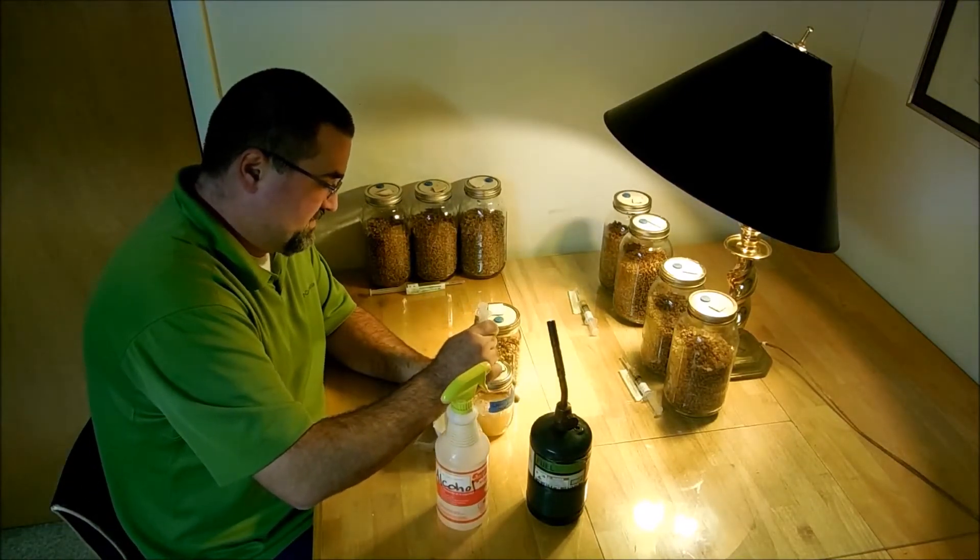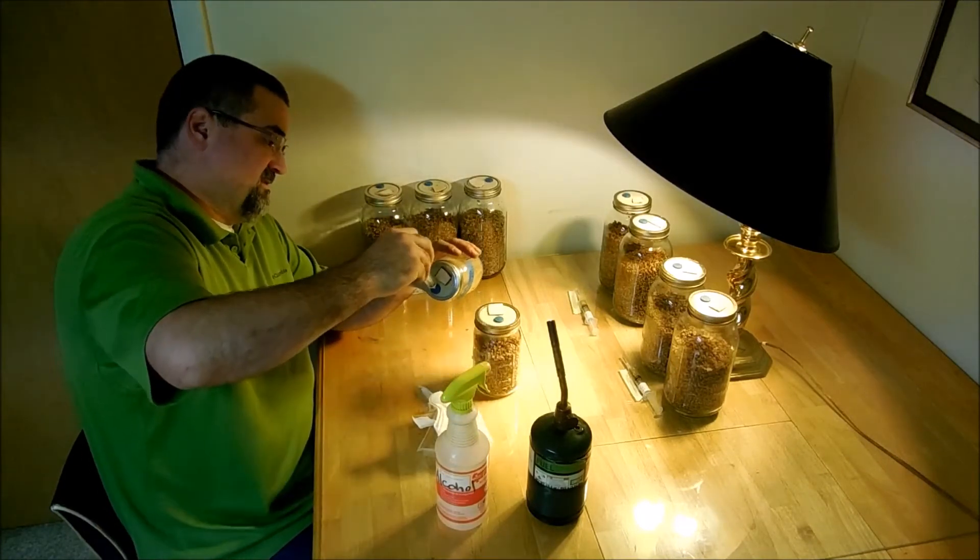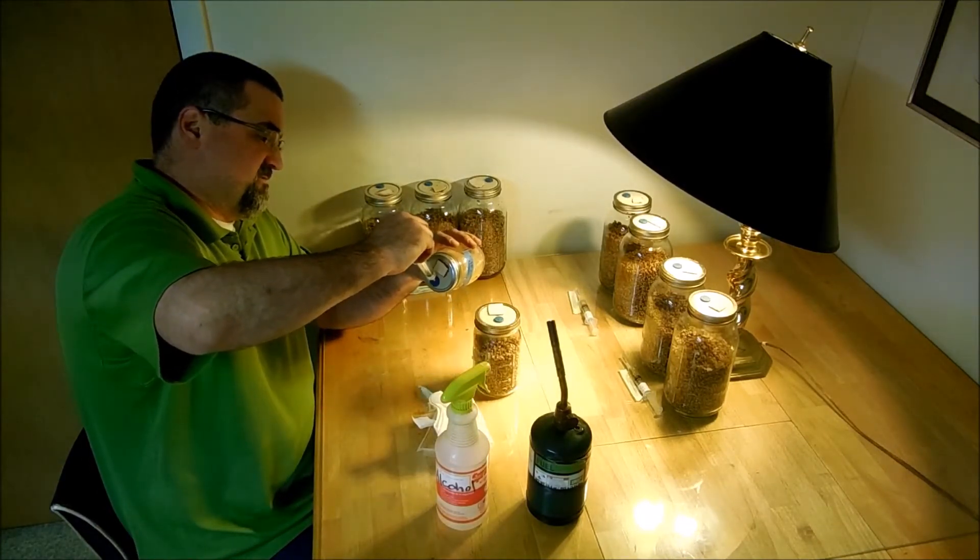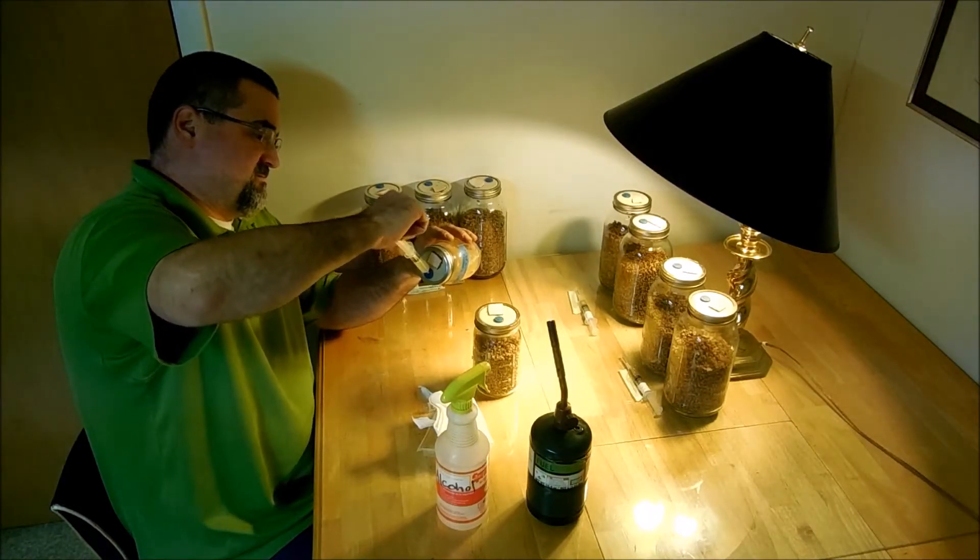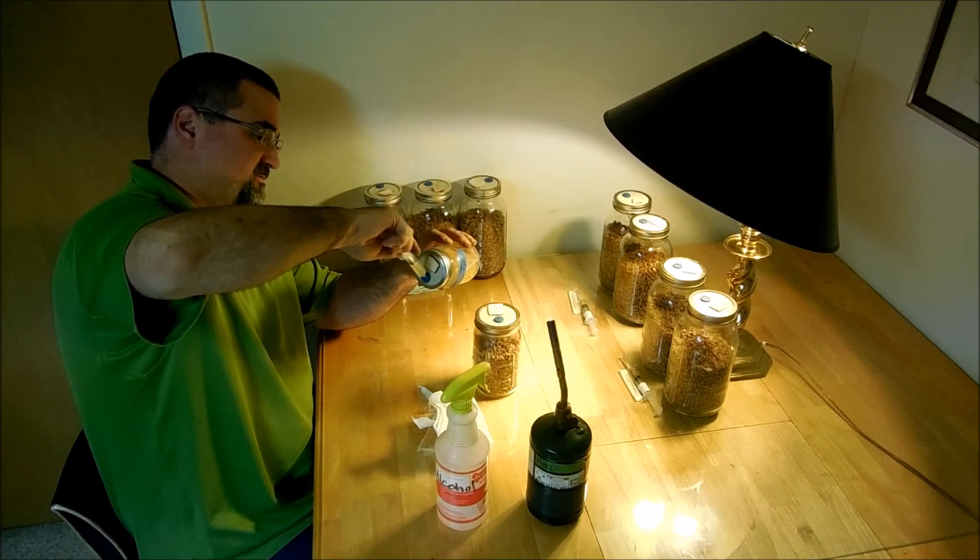So I'll stick this in there and just draw out a nice big syringe full.